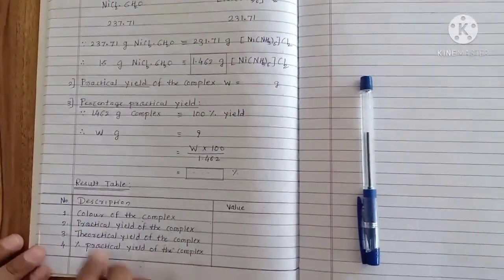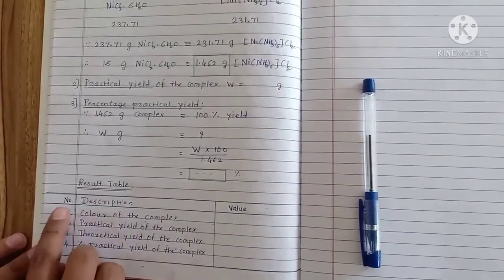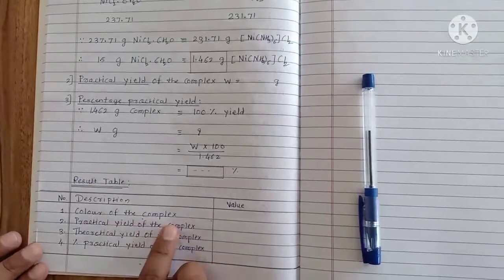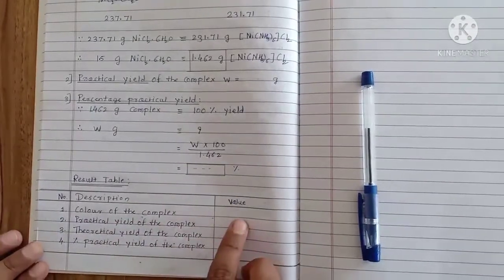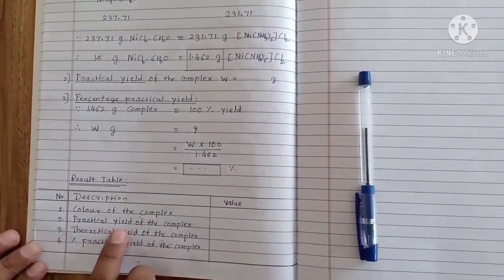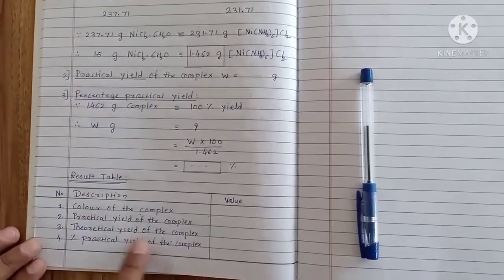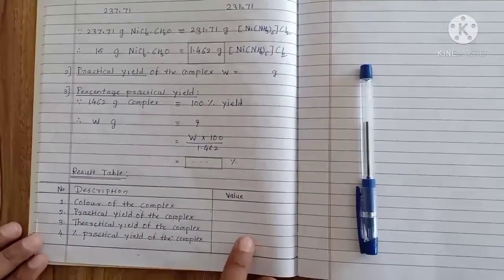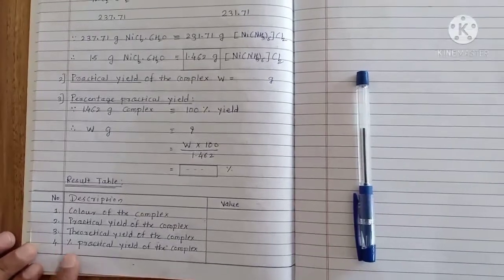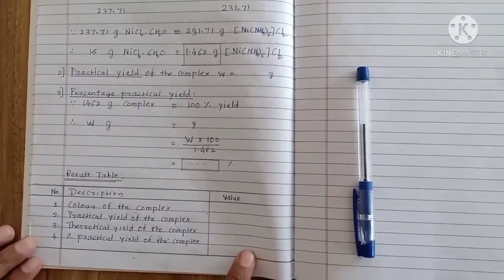The practical yield of our complex is W grams, which we have to record. The percentage practical yield is calculated as: W × 100 / 1.462. In the result table, we record: the color of our complex — intense violet; the practical yield of the complex; the theoretical yield of the complex (1.462 g); and from that we calculate the percentage practical yield.